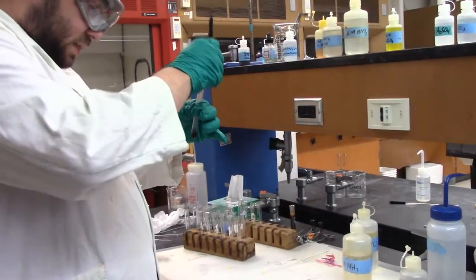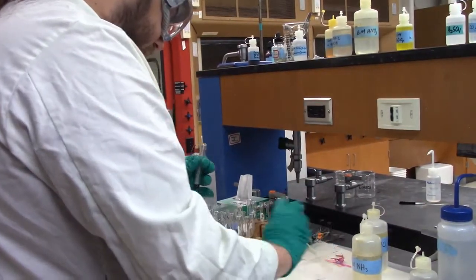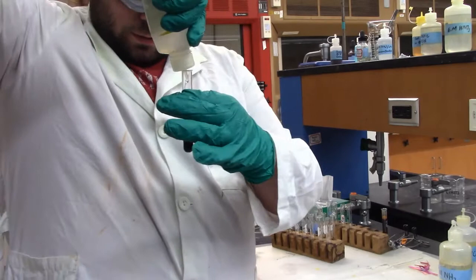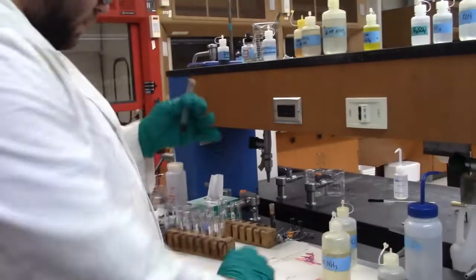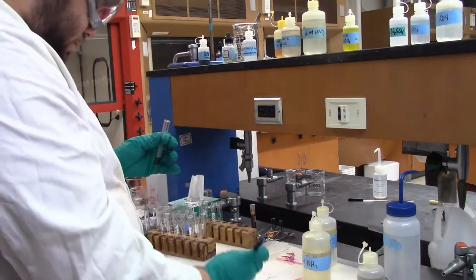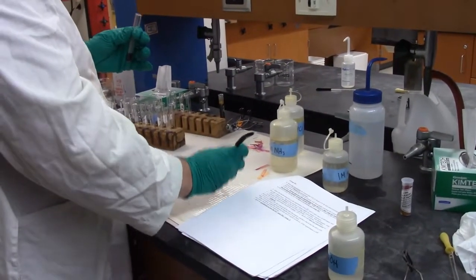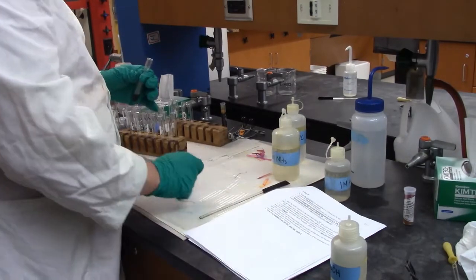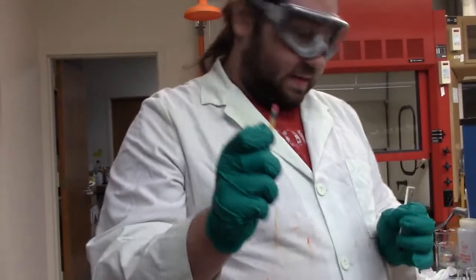Give it a good mix. Test it. Oh, and we're still acidic too. Well, let's keep going. How about now? There we go. Now it's basic.